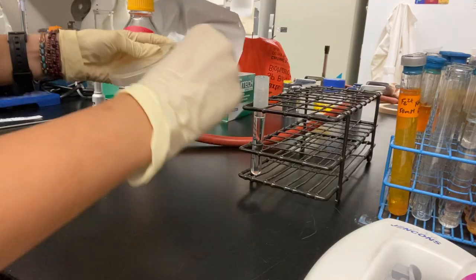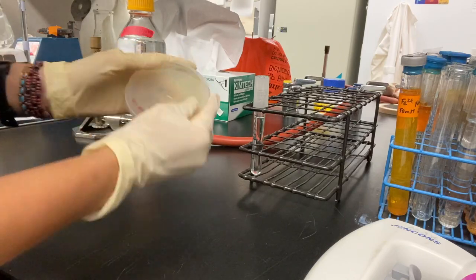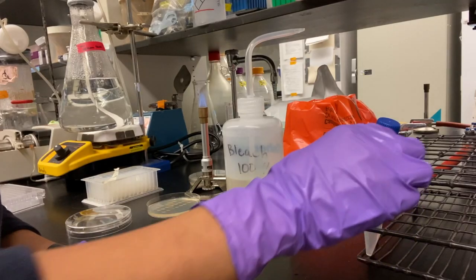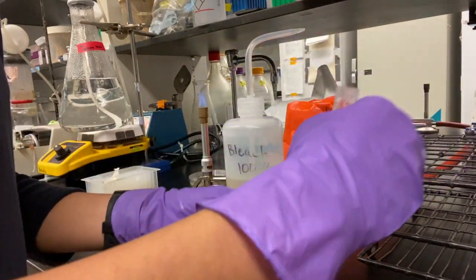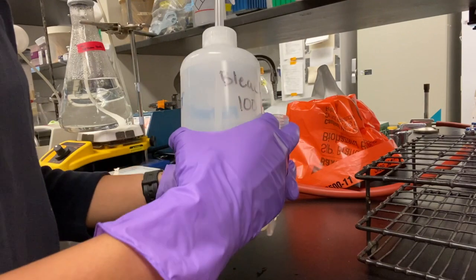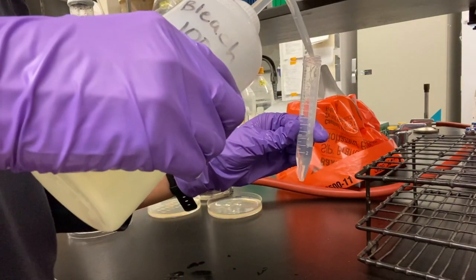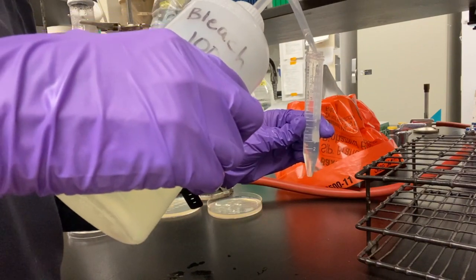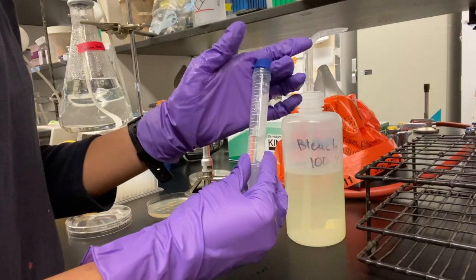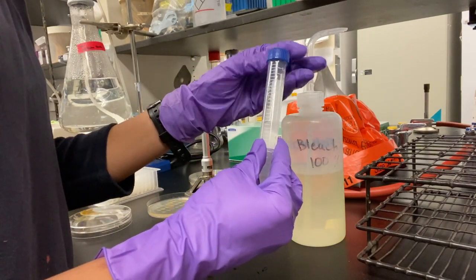When you can no longer see the spots, close the Petri dish, parafilm, and place upside down in the 37C room to incubate. Now that we are done with the chemostat liquid culture, we need to inactivate it. Use the disinfectant 100% bleach and pour just enough to make it a 10% bleach solution. The Pseudomonas liquid culture sample can now be disposed of in the biological waste.